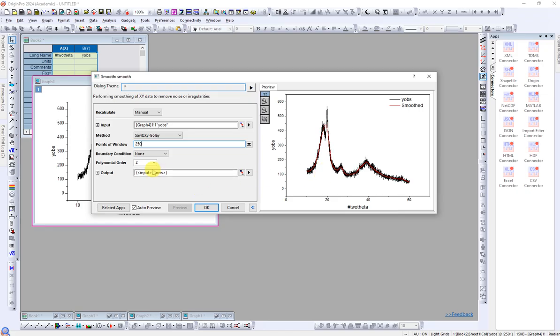Yeah, so from 250 you can see 2 peaks are converted into 1 red peak, which is not correct, because there are 2 peaks related to different phases of the material. So you have to reduce this value, maybe 200. Let's see. Yeah, but still you can see this peak should be here or under this, but it's slightly shifted towards the lower 2 theta value, which is also incorrect. So let's further reduce the value to 100.